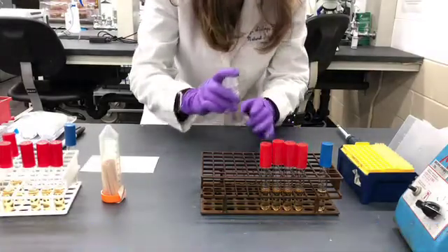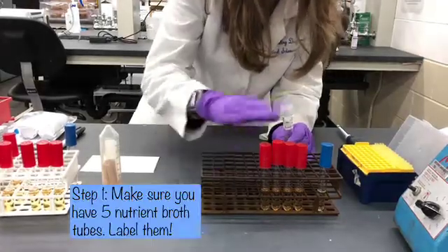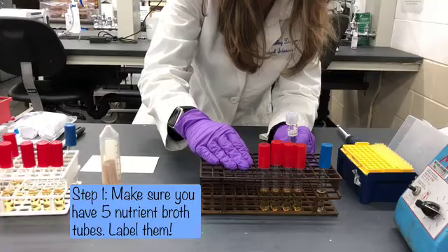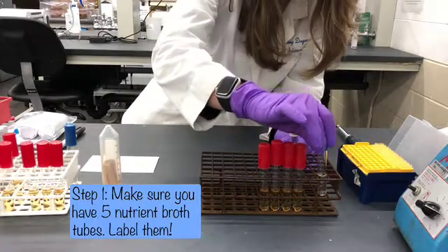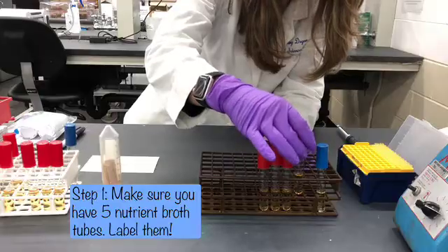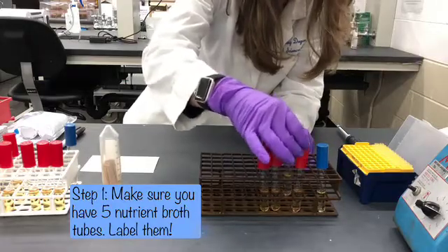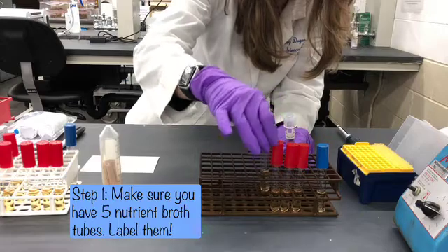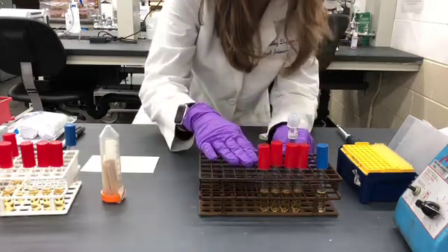We're going to start off with five tubes of nutrient broth. We're going to label them: one labeled blank, one labeled 20 degrees, 37 degrees, 45 degrees, and 55 degrees. At this point, all of these are sterile.